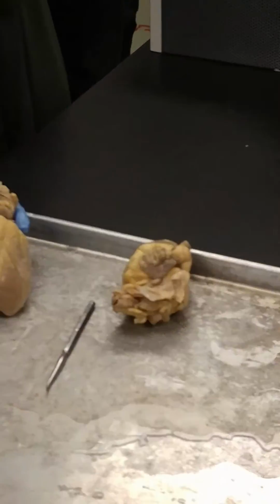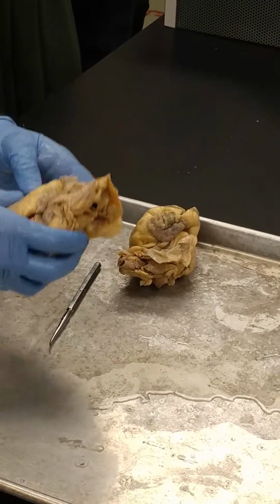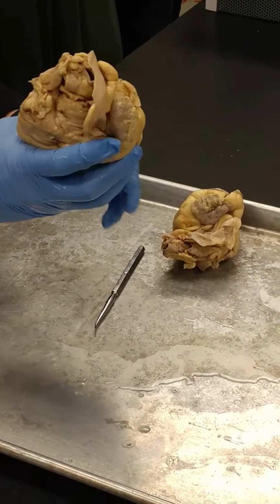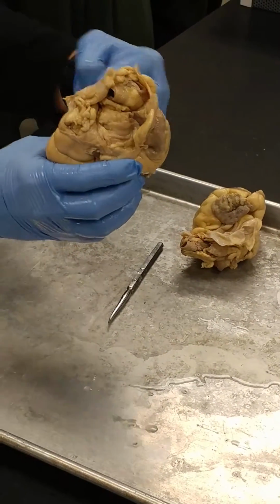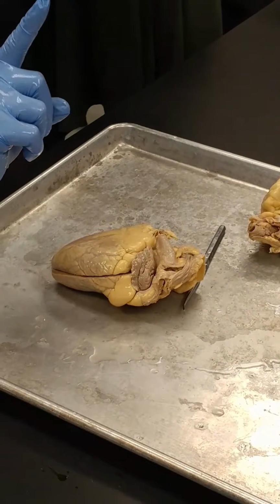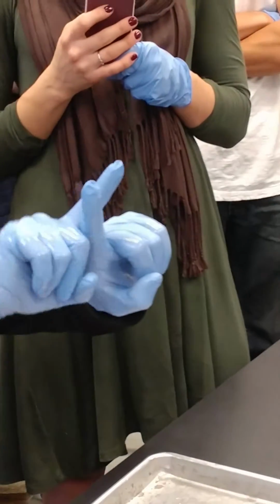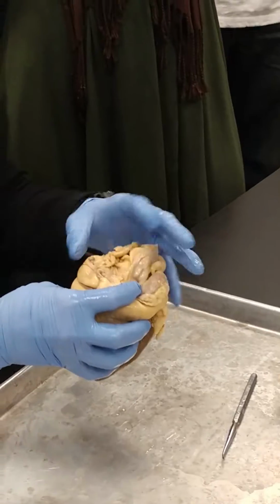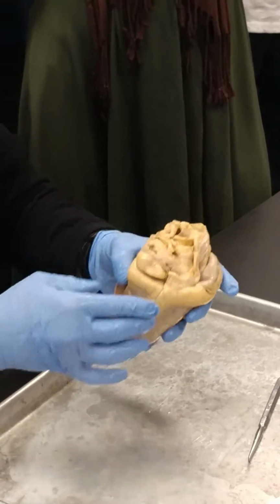So it's posterior? Yeah, well, no, it's actually kind of more anterior. What happens is, so this is anterior, okay, that's the front of the heart. That's the pulmonary trunk coming up right there. Okay, right? That right there. So the pulmonary trunk kind of comes up like this. The aorta goes up like this. The aorta comes like this and across and up and then down. The problem is that most of these vessels have been cut so close to the heart that it's hard to find out which one's which. But we'll do our best here.